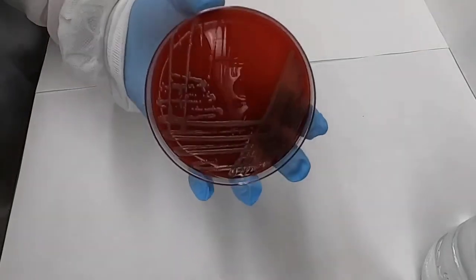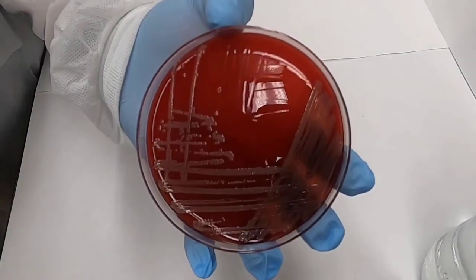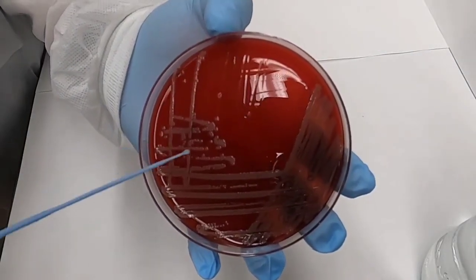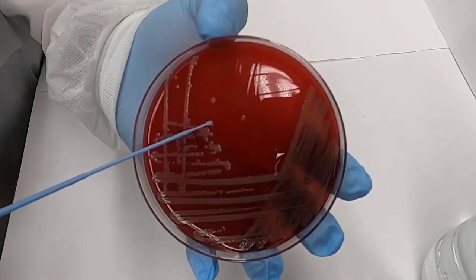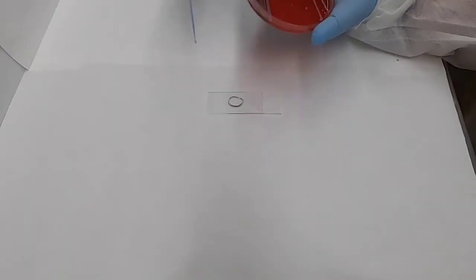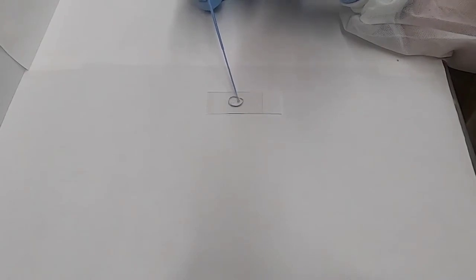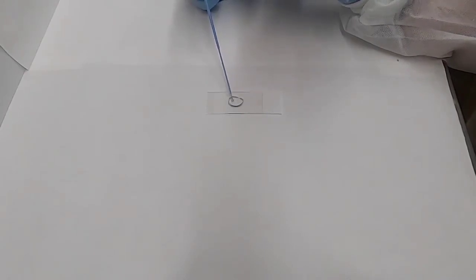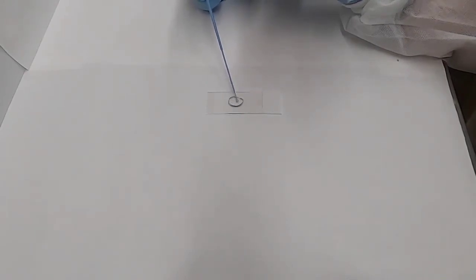Use a calibrated loop to collect a small amount of water and deposit it into the circle by gently tapping the loop. Next, use a sterile loop to select a colony you'd like to visualize. Remember, just touch the tip of the colony — there are billions of bacteria there and you only need a little bit. Spread them around to get a nice even layer, and wait for your slide to dry.